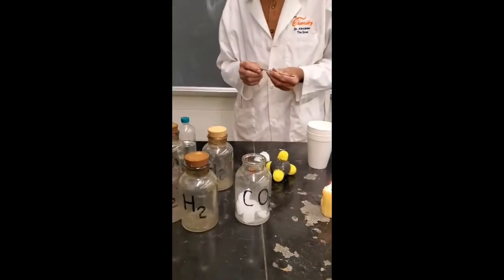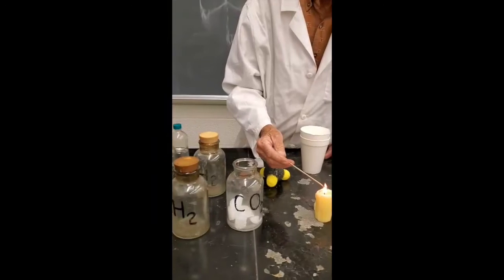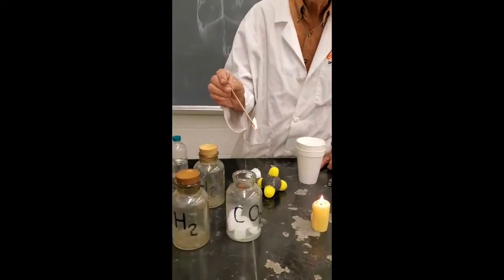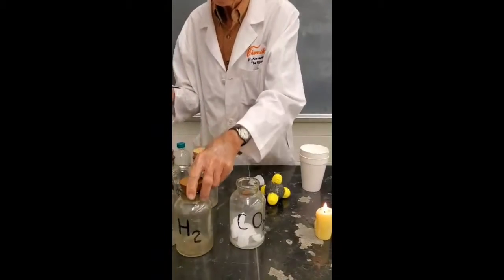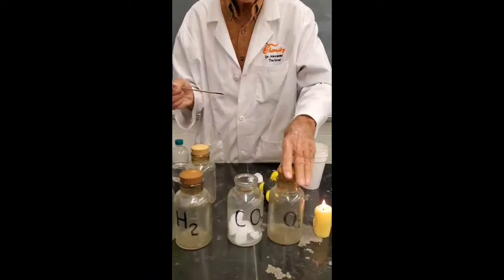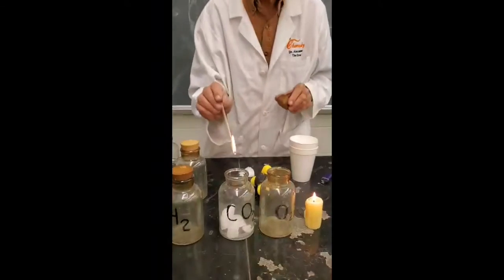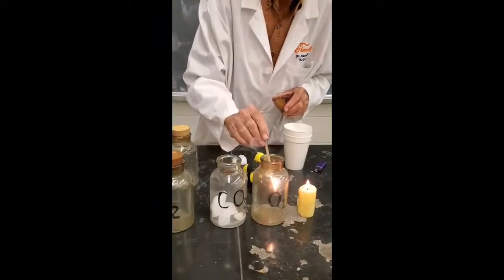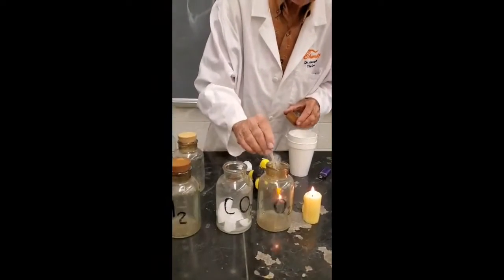Now the thing is, CO2 does not support combustion. So let's see if I light this stick. In fact, we use CO2 to put out fire. See if it'll put out the fire. You ready? You see it go out? Now where's my oxygen? Is this the oxygen? No, this is the oxygen. Is this the oxygen? Yes. So if I want to relight it, I can do over here. If I want to put it out, put it there. Relight it here, put it out here. Light it here, put it out here. See how chemists have fun? Starting to use up the oxygen though.